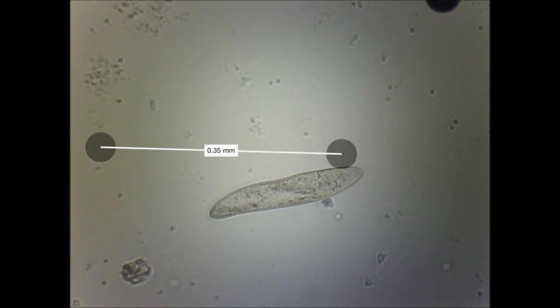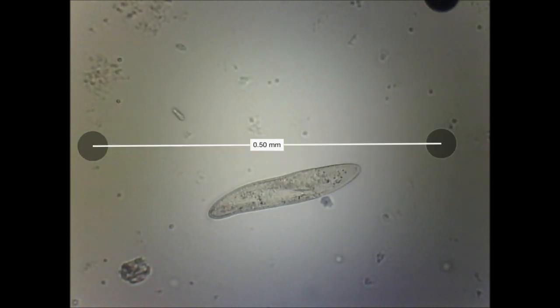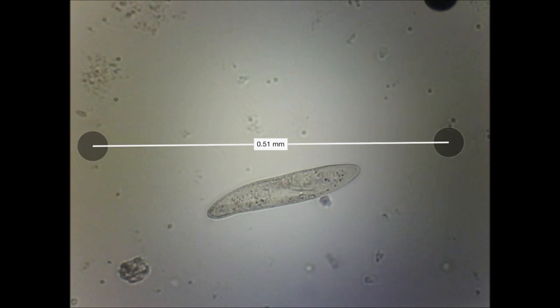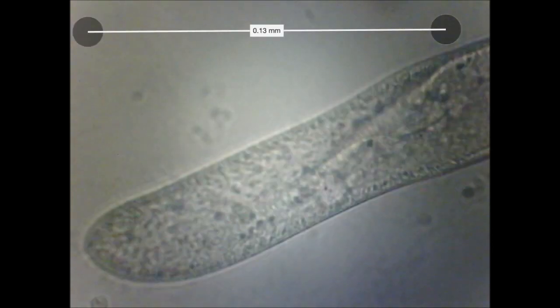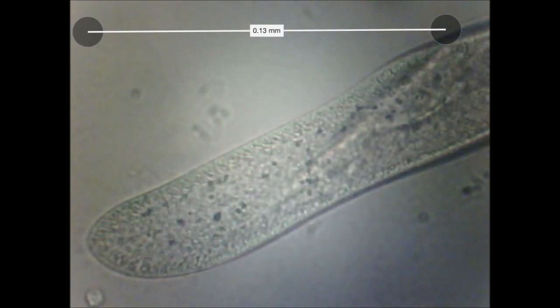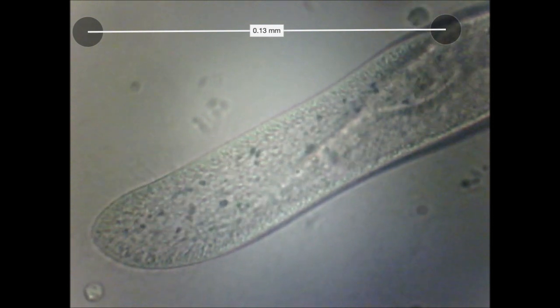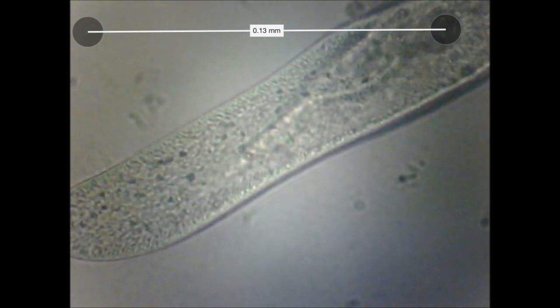It's slow enough that I can actually get out and measure it. We can see it's about a fifth of a millimeter in length, so very, very small. I can even extend my measurement there. And now we can start to actually zoom in and look even more closely.